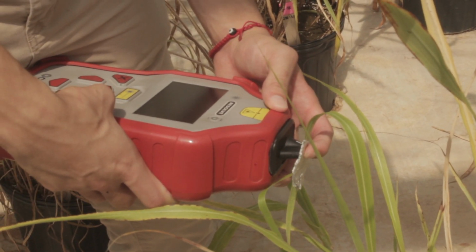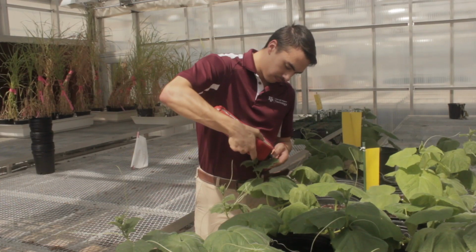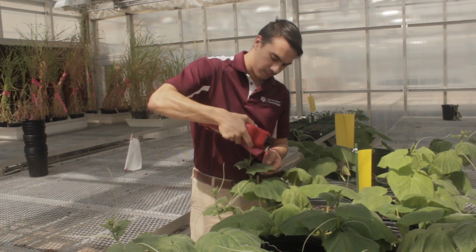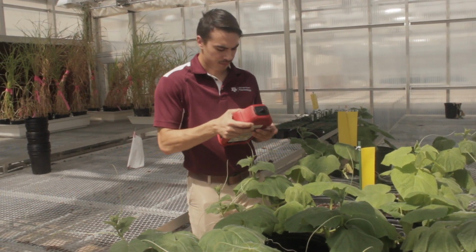In our lab, we have evidence that Raman can be used to detect viral, fungal, and bacterial diseases in a large number of plants, along with abiotic stresses such as salinity, arsenic, and other heavy metals. This technology has been successfully utilized in previous projects. Among them, we've been able to detect the huanglongbing disease in citrus crops, identify the tomato spotted wilt virus in tomato crops, and effectively assess salinity stress in maize crops.